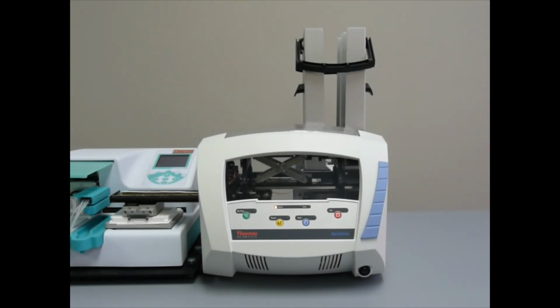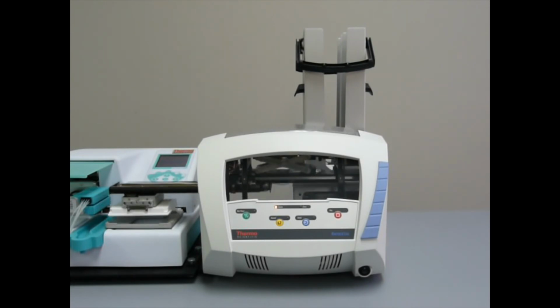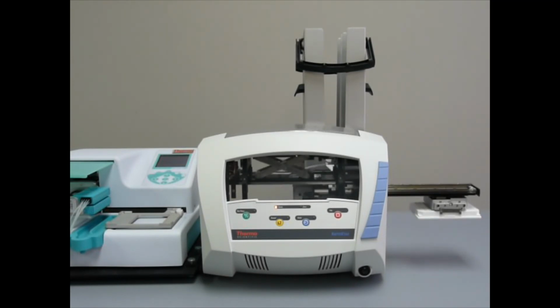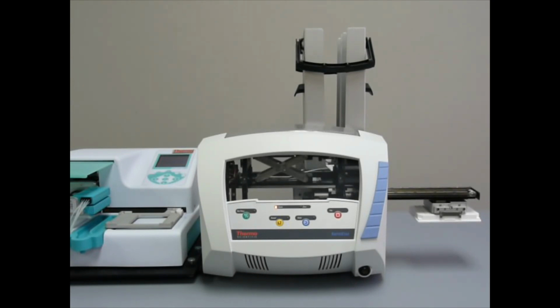Let's look at Safe 2. You can see that the RapidStak arm has moved to an upright position, and then we'll go to Instrument 2. You don't actually have an instrument there, but you could see if there was one there where the robot would place the plates. Now let's say we didn't like that location and we wanted to adjust the movements.